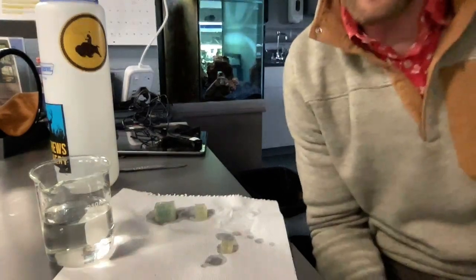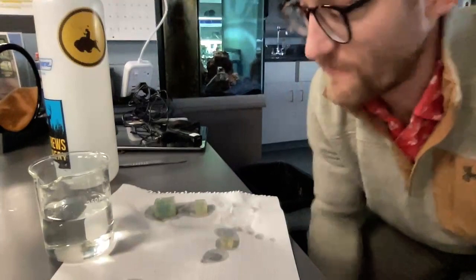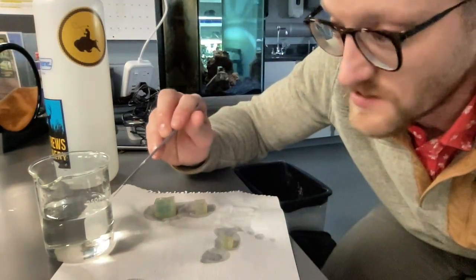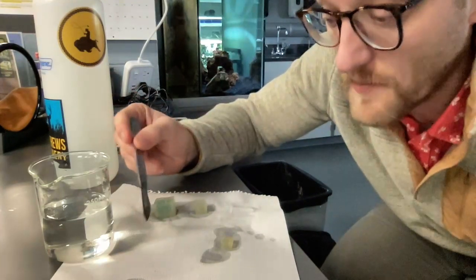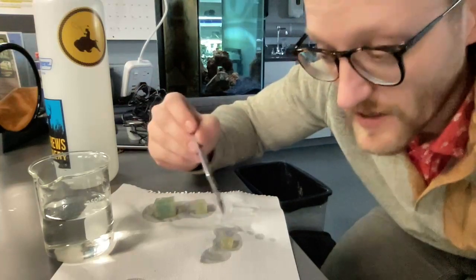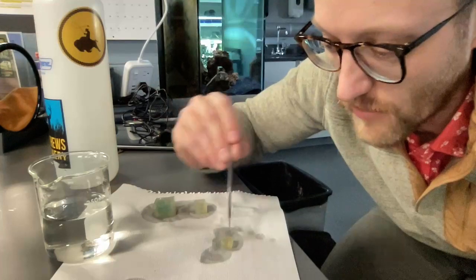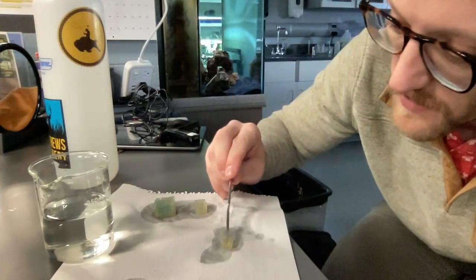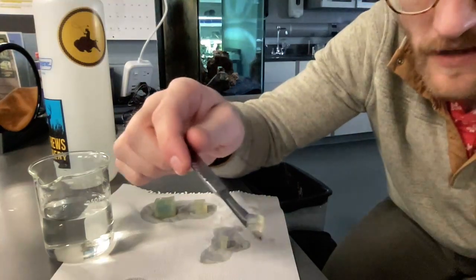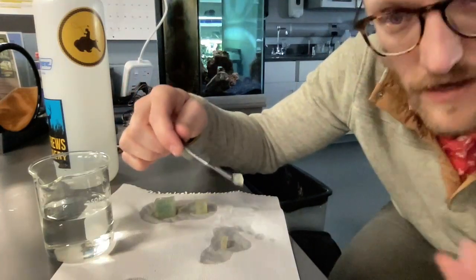Remember, if the vinegar represents the nutrients that the cell needs, we want to see whether those nutrients made it all the way through the cell. How do we know that? If they've made it all the way through, the cell should be yellow all the way through. So if we cut this in half and look, it's all the same color throughout, which tells us the vinegar was able to make it all the way through the smallest cell.